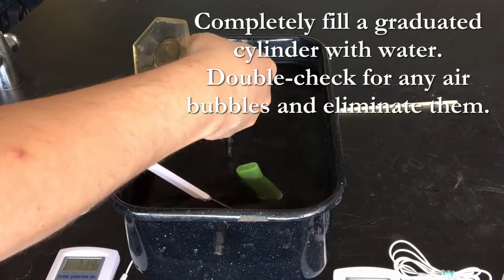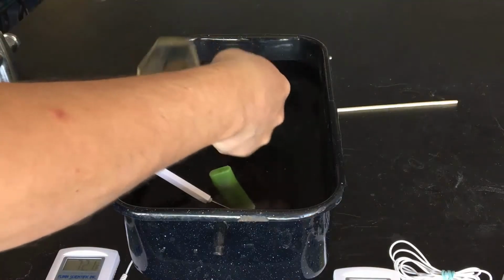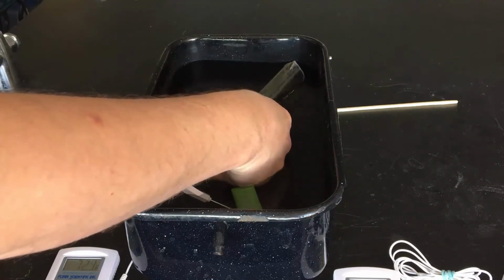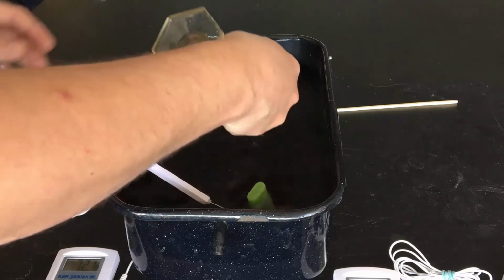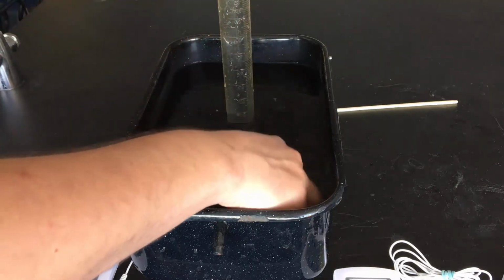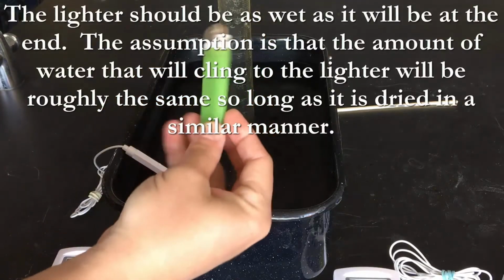Right now there's an air bubble that's trapped. Sometimes this happens due to surface tension and some other things that allow water droplets to form little pockets of gas on the graduated cylinder. So make sure you've gotten all of that gas out. If you don't get all the gas out, just realize this is going to be one of your sources of error.